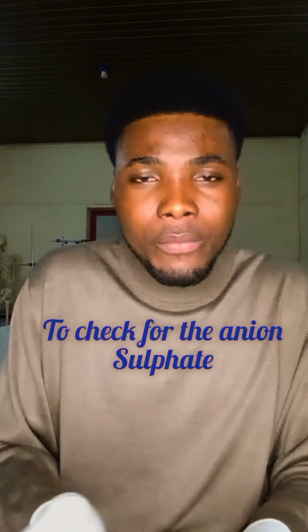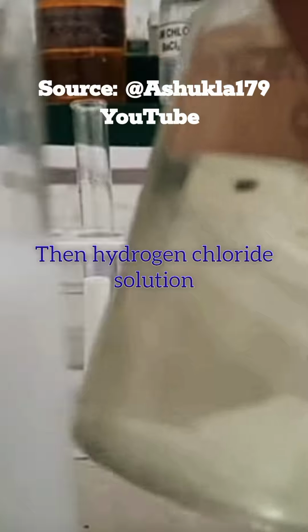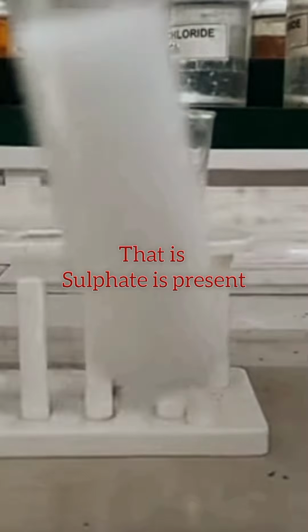Now, to check for the sulfate, how did I know that it is sulfate? I just add barium chloride. Now, this is barium chloride. I add some barium chloride to another sample of the salt, and I see a white precipitate. Then I add hydrochloric acid solution, and the precipitate does not dissolve; the precipitate remains. It is sulfate that gives this kind of test.